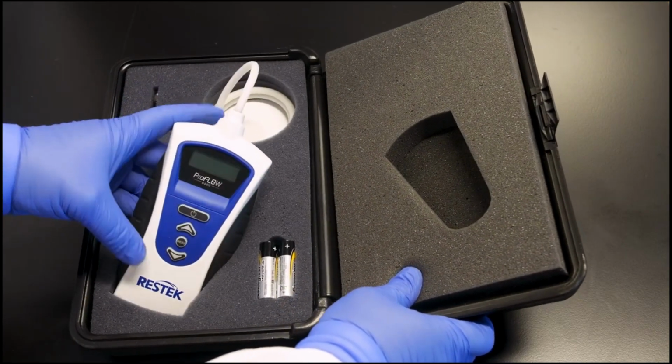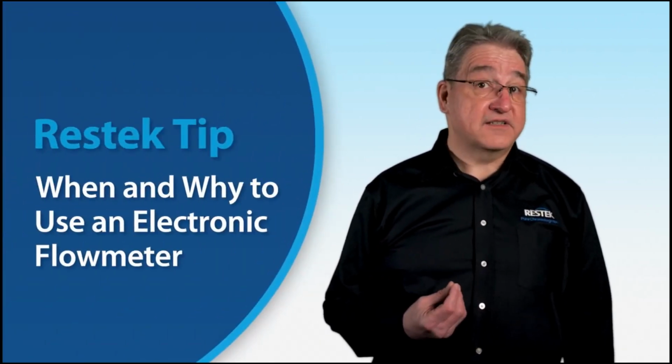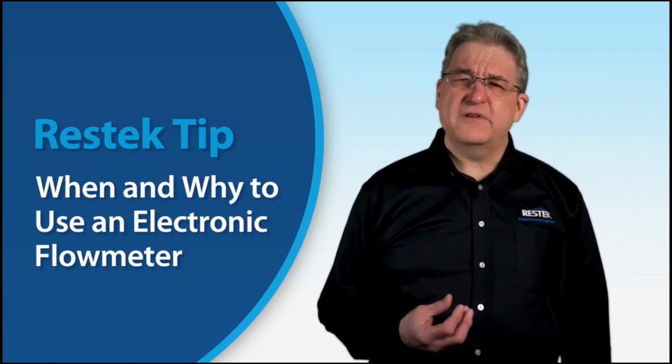Flowmeters are often seen as essential tools for GC labs. But since modern instruments feature advanced pressure controls, valves, and built-in flow measurement software, is it necessary to have a handheld electronic flow meter? In this Restek tip, we're going to discuss flow meters. What are some of the situations they can be used in, and why would you use one instead of your instrument, specifically focusing on gas chromatography?